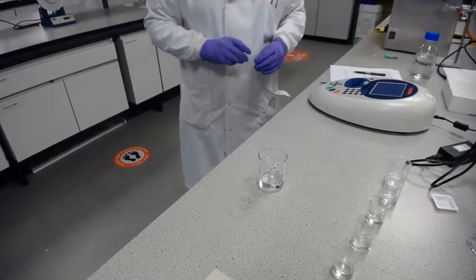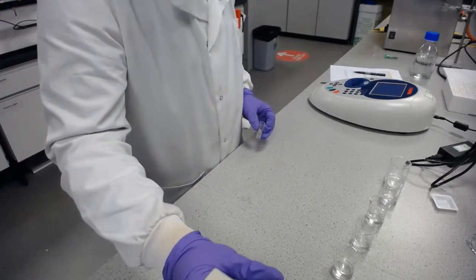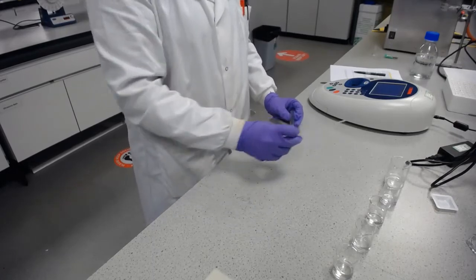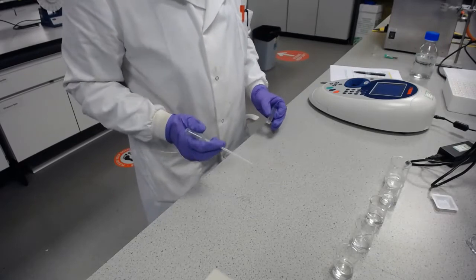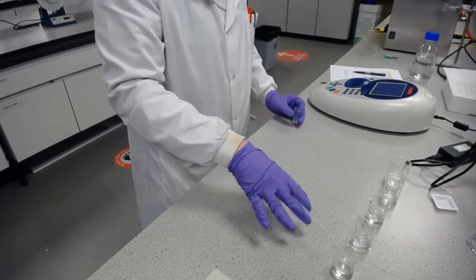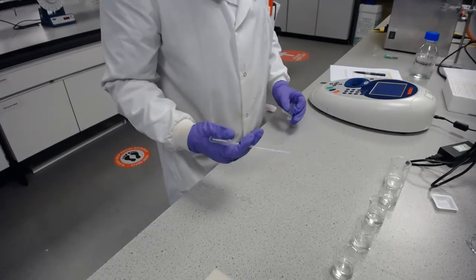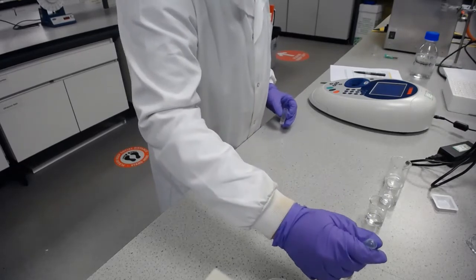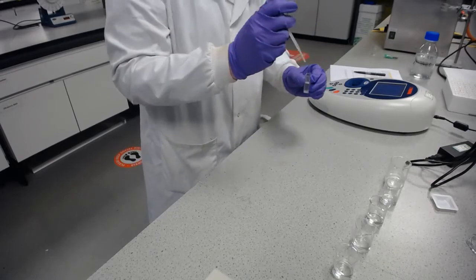And now what I'm going to do is, using this same pipette, start with the lowest concentration and work my way up to the highest concentration. In doing so, I can just use the same pipette filler because I'm not contaminating the lower concentrations with the higher concentrations, and all I'll be doing at worst is the tiniest little dilution of these. So in practice and generally, you can just do this. It's absolutely fine.